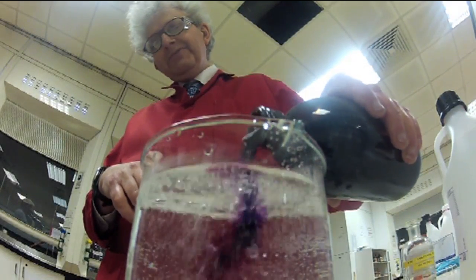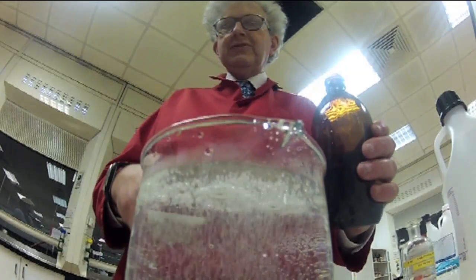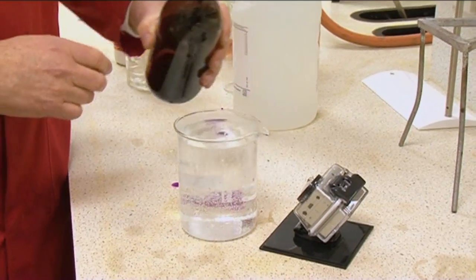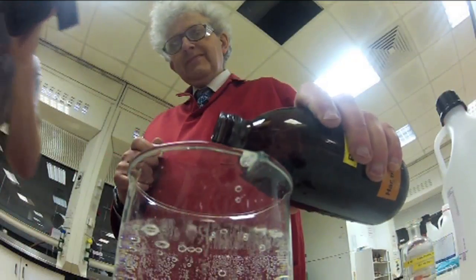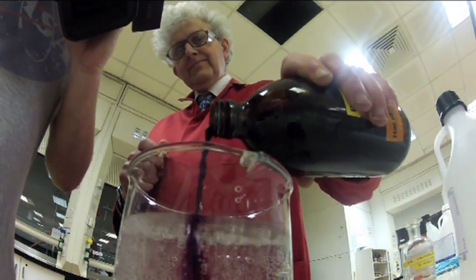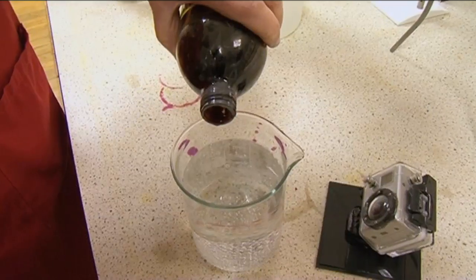And you can see it's releasing oxygen from the hydrogen peroxide. So when it hits the surface, the manganese, which is bound to oxygen in permanganate, reacts and loses its oxygen and forms manganese ions, manganese 2+, for those of you who are chemists, which are completely colorless. So it goes from this very intensely colored salt to the colorless one. So it's like magic, isn't it?